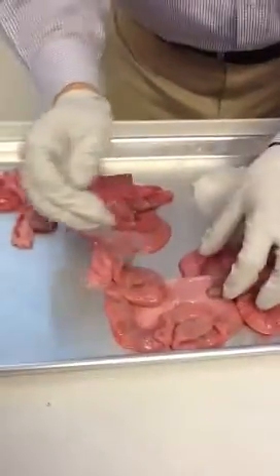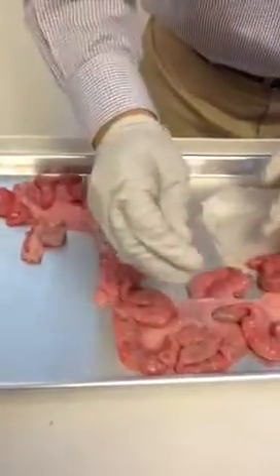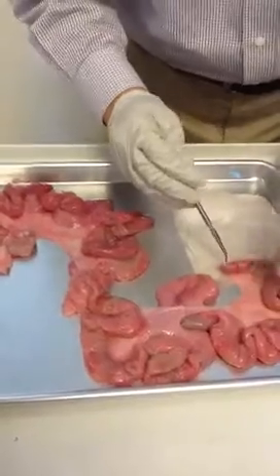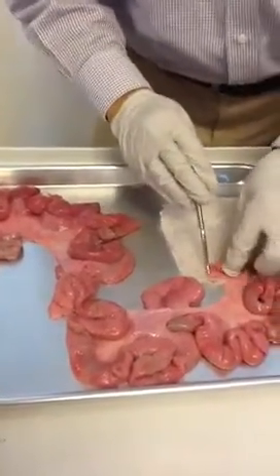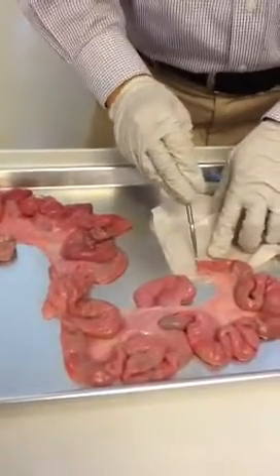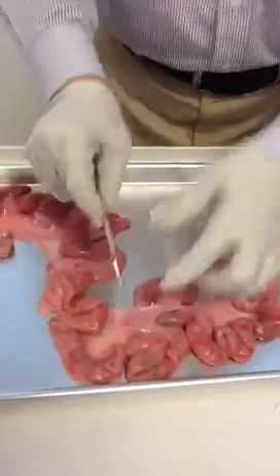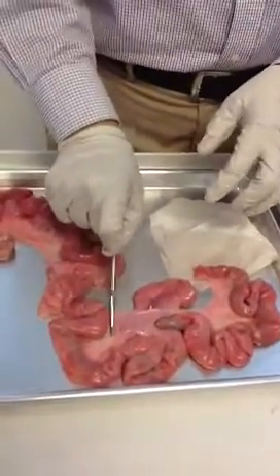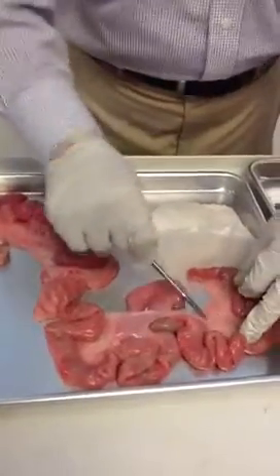And all the way up here, unfortunately they cut out the ovary on one side. The big membrane you see here is just like in the small intestine — very similar to the mesentery. It's still membrane. You can see the blood vessel — it's the broad ligament.